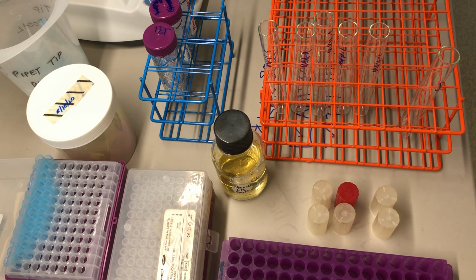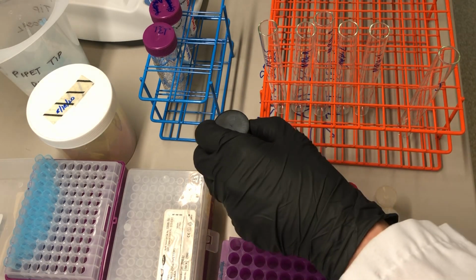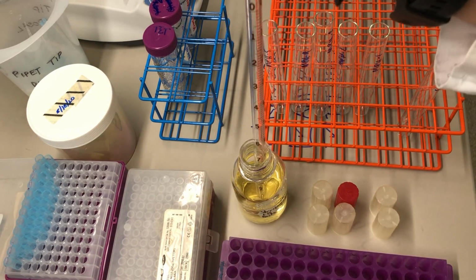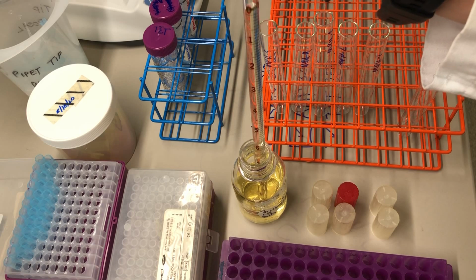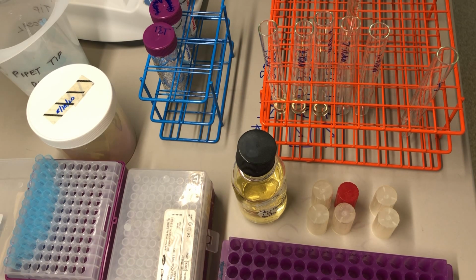You could dial in 1 milliliter and do it twice for each tube. But I'm in a rush, so I'm going to use a 10 milliliter pipette and the red bulb. Just like we did with pipetting liquids, I'm going to start by fitting the red bulb onto the 10 milliliter pipette. Take up all the media that I need, and then pipette 2, 4, 6. I'm just looking at the markings on the graduated pipette until I get all the way to 10. And now each of the tubes has 2 milliliters.